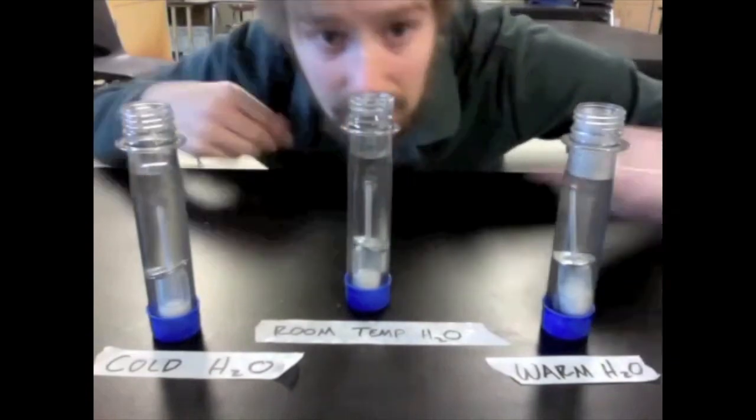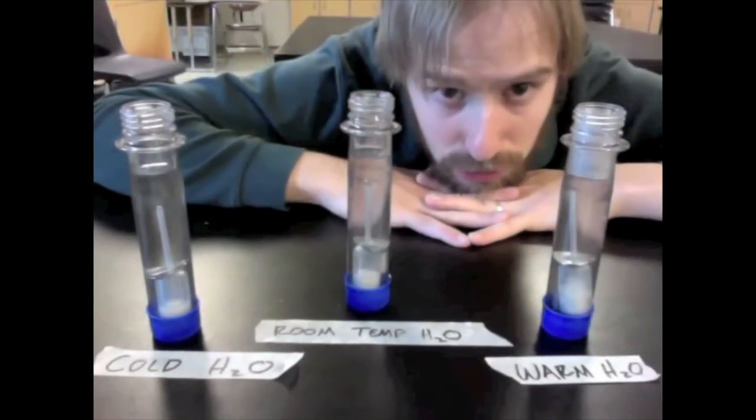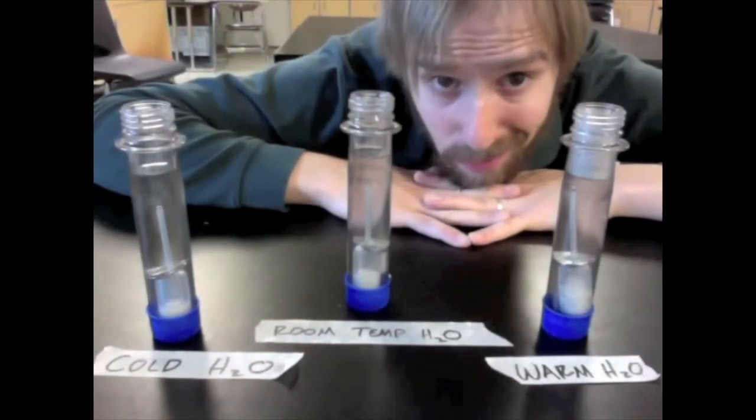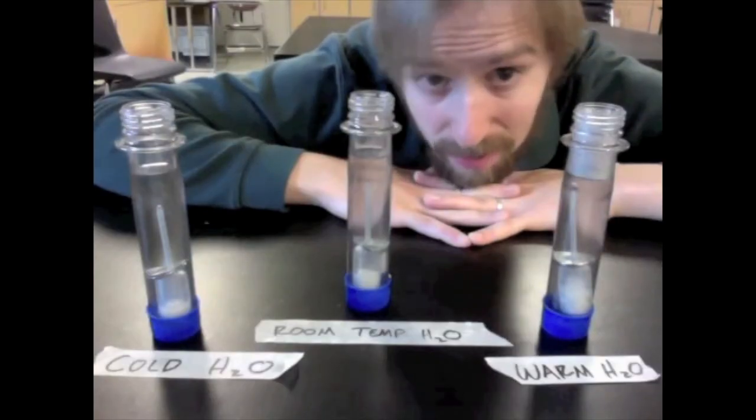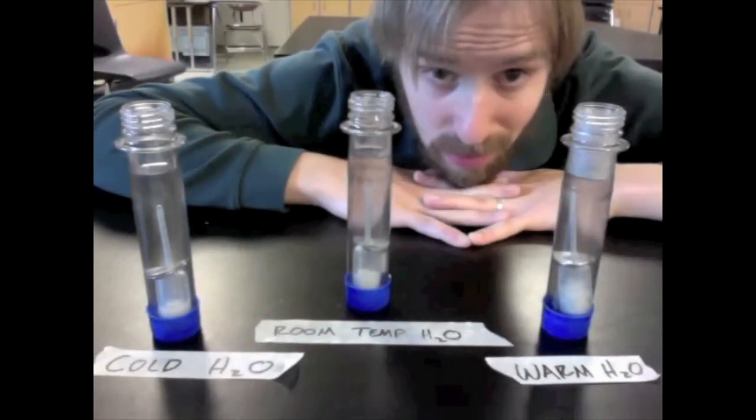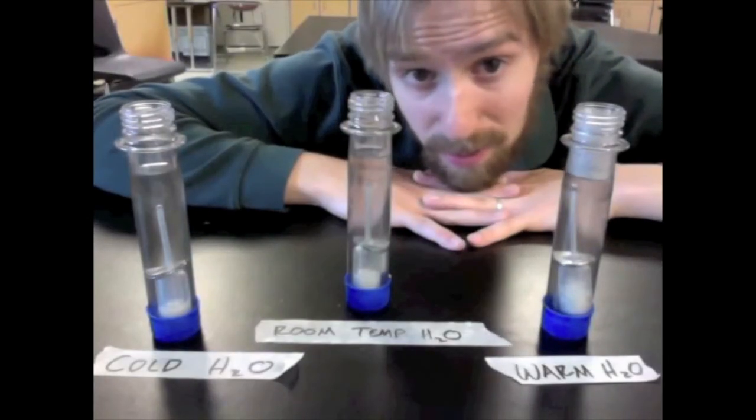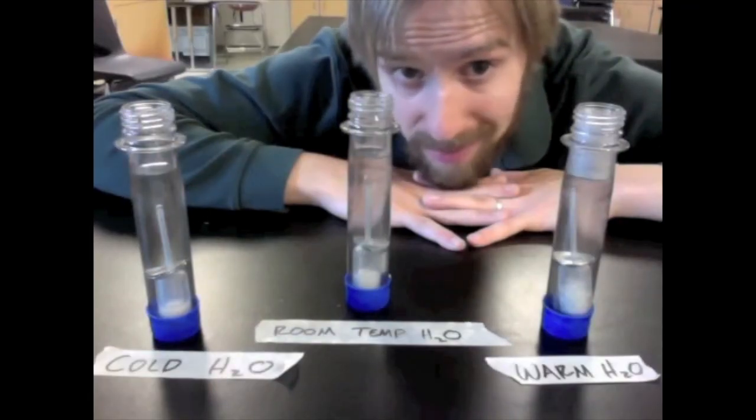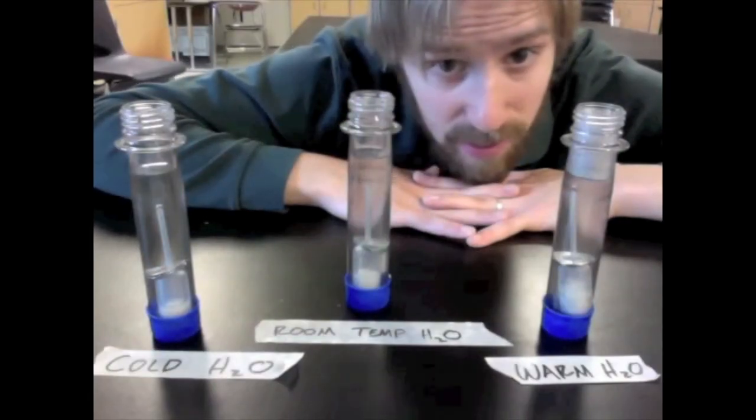It's just about time. So now as good scientists, it is time to analyze our results. So if you've been keeping track of how many bubbles have been released by each one of these, you know a little something about how temperature affects the rate of fermentation in regular, everyday, ordinary bread yeast.